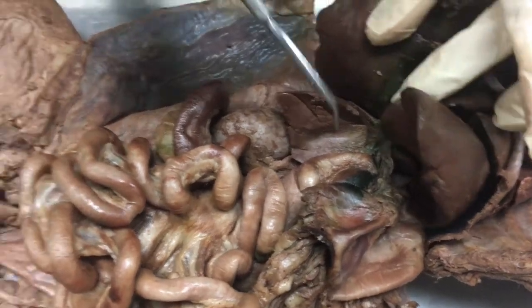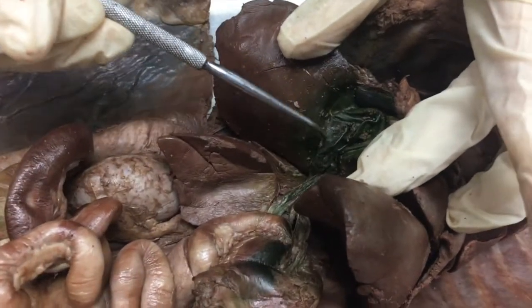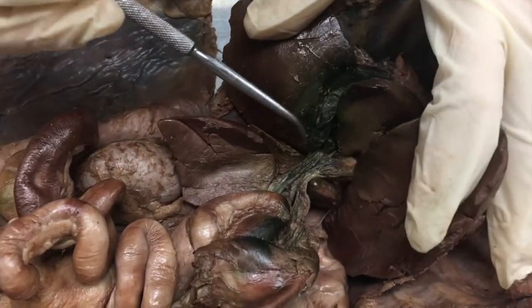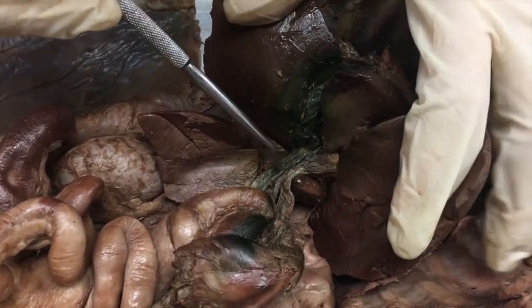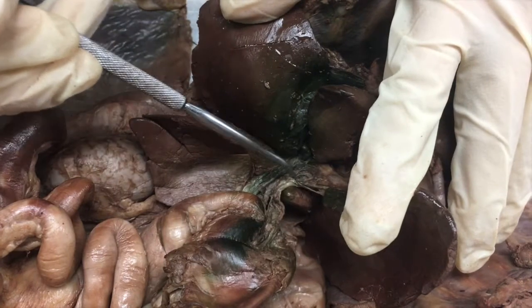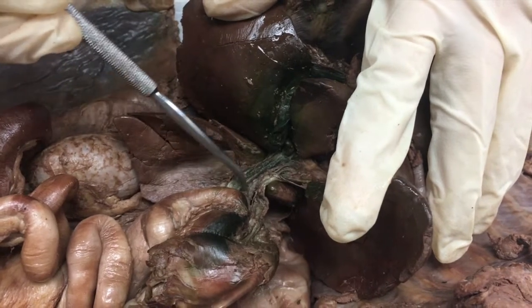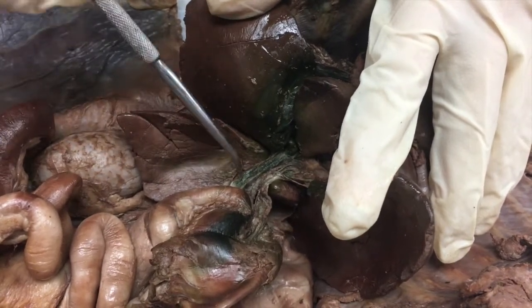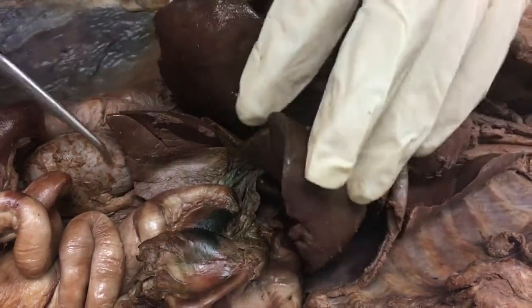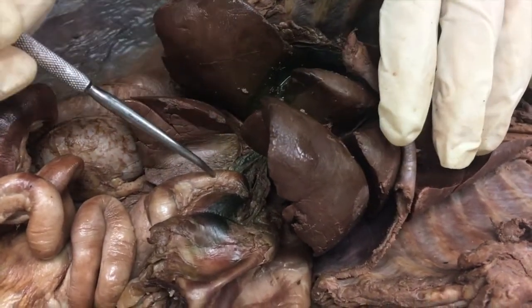Within the right medial lobe is the gallbladder — this greenish structure right here. From the gallbladder you have the cystic duct, and from the left lateral lobe of the liver you have the hepatic duct. They come together to form the common bile duct, which feeds into the ampulla of Vater, then passes through the sphincter of Oddi — a muscle that controls the secretion of bile to the duodenum.